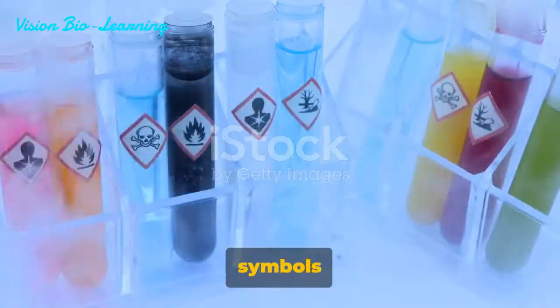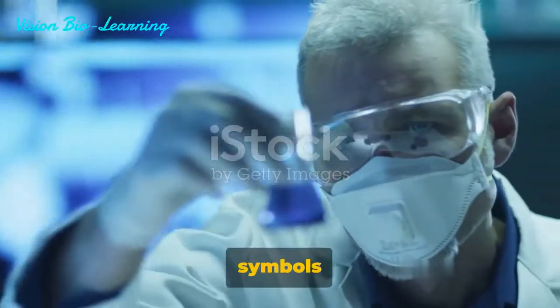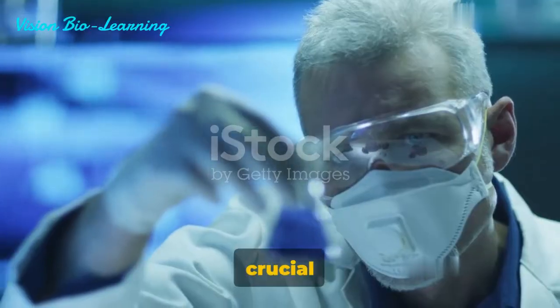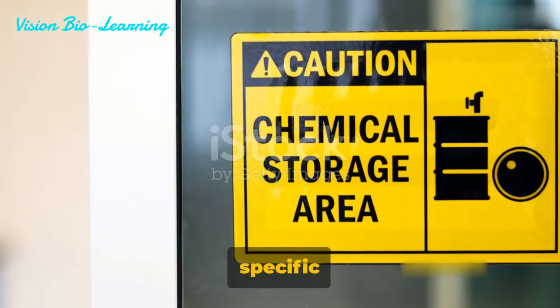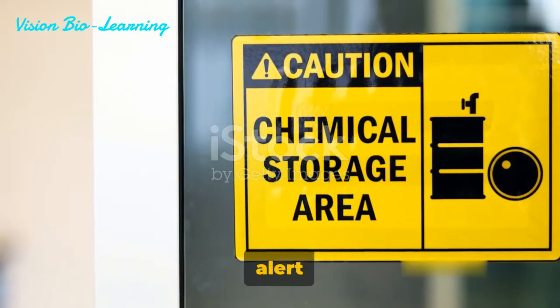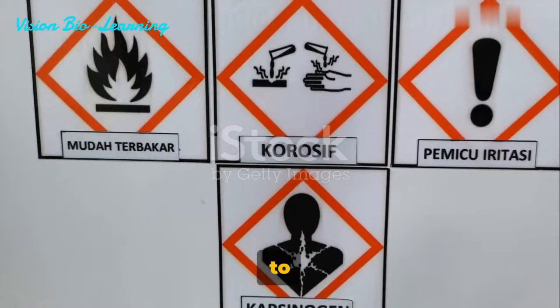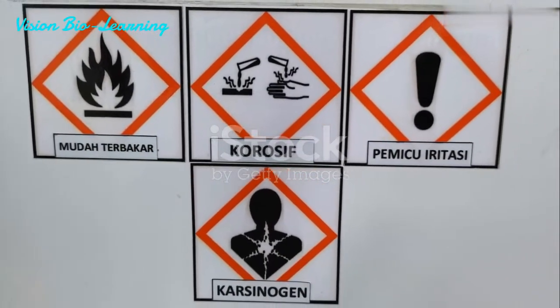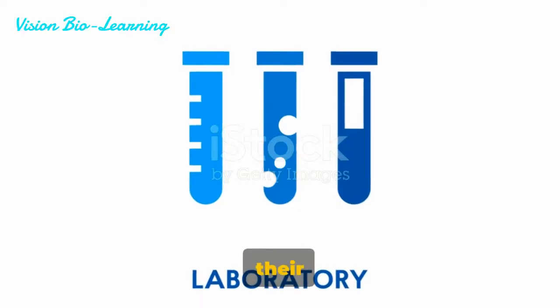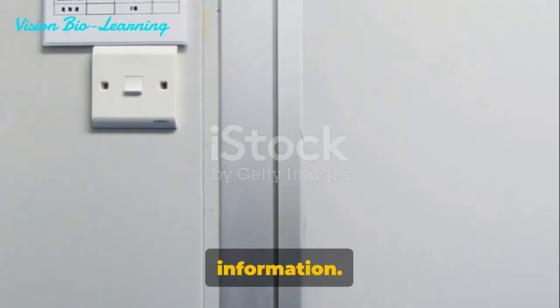Do you know what these laboratory symbols mean? In any lab, symbols serve as a universal language, crucial for maintaining safety. They represent specific instructions, alert us to potential hazards, and guide us in how to interact with different materials and equipment. They might vary between labs, but their purpose remains the same: to communicate vital information.